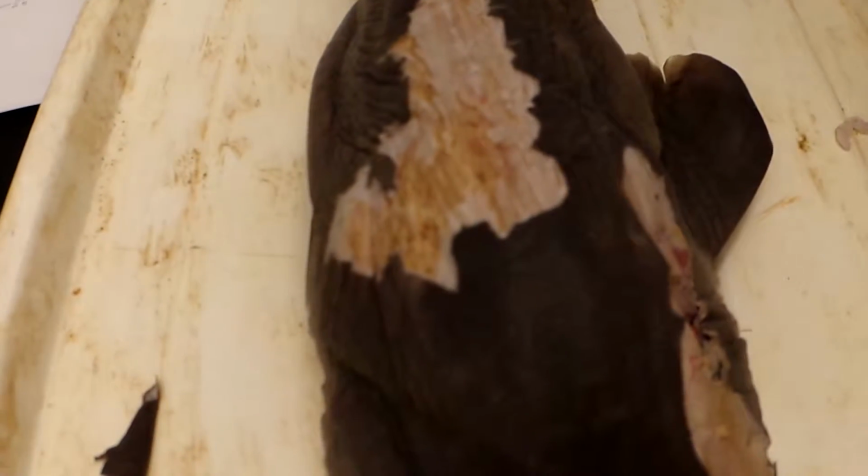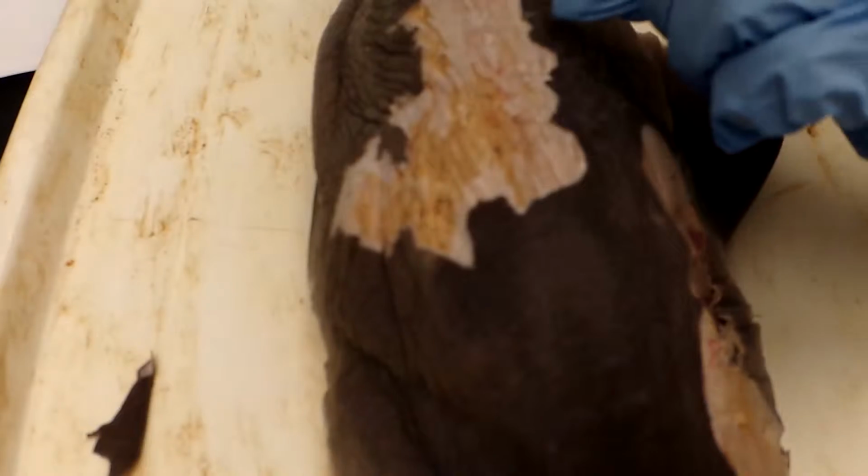This is the shark. First is the trunk and axial musculature. The first muscle is the myomeres, which is the darker muscle in this area. The origin is the vertebral column, and the insertion is the integument. Next is the horizontal septum, which is the line that goes down the back of the animal. And then the myoseptum are the whiter areas of muscle that separate the myomeres.